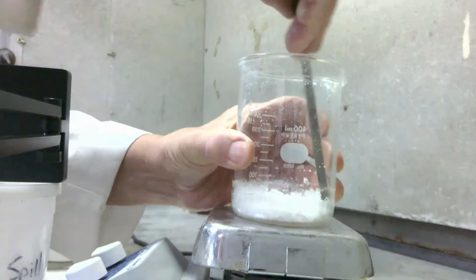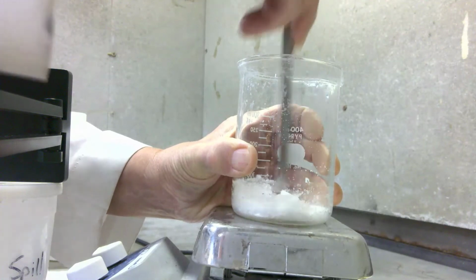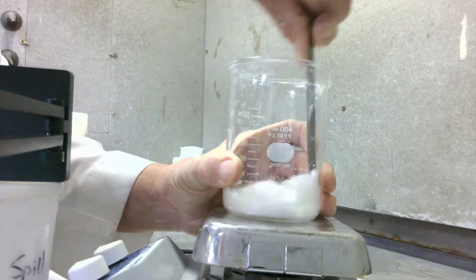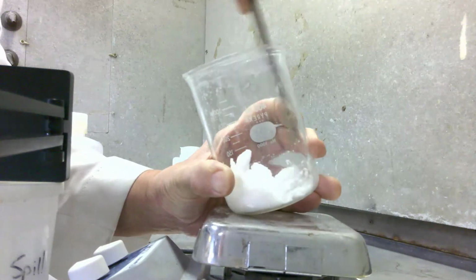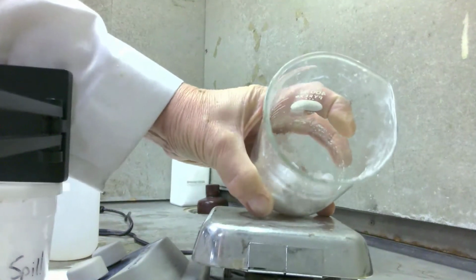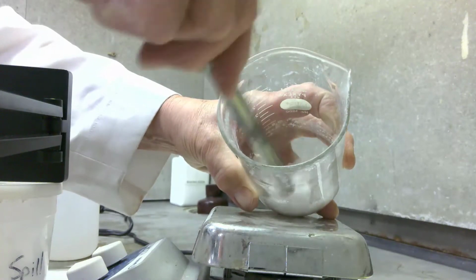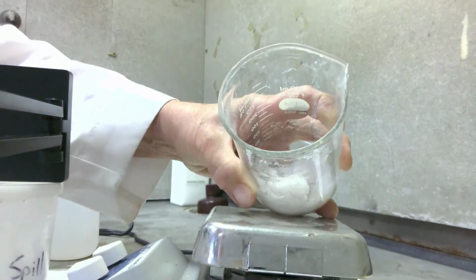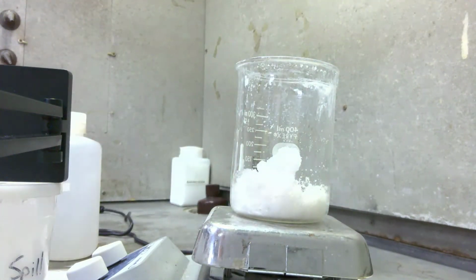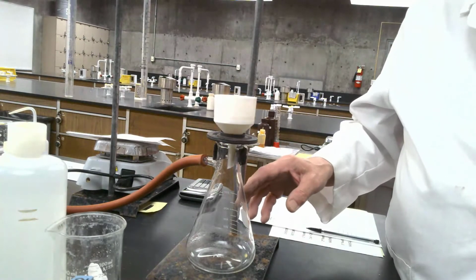So I'm going to loosen the crystals with a spatula. Okay, so you can sort of see the crystals. And they're sort of damp. You can see that they're damp. And what we're going to do is rinse them with alcohol, ethyl alcohol, drinking alcohol, or ethanol. Okay, this is the last part of the experiment.